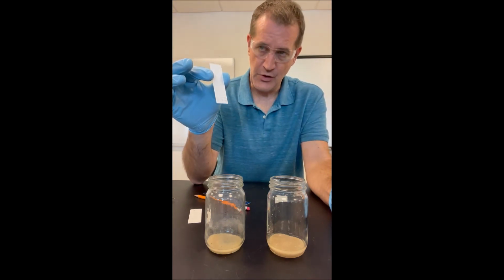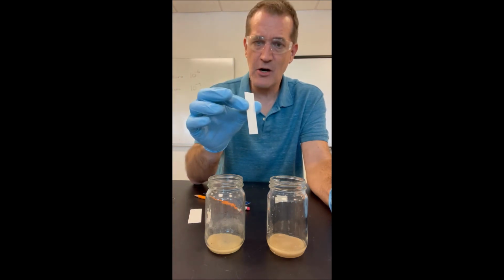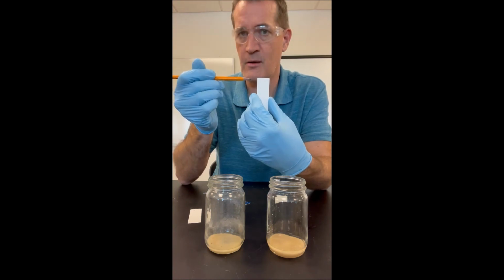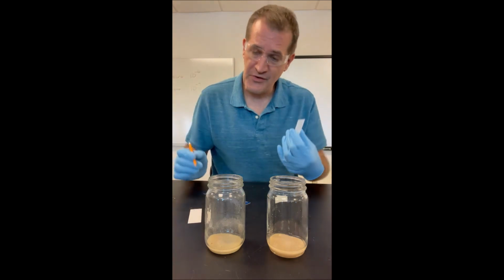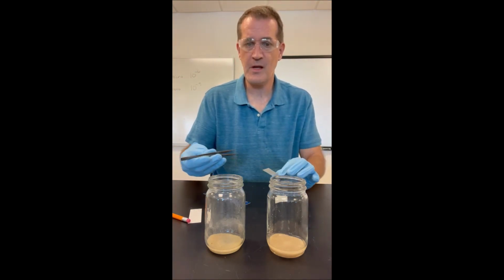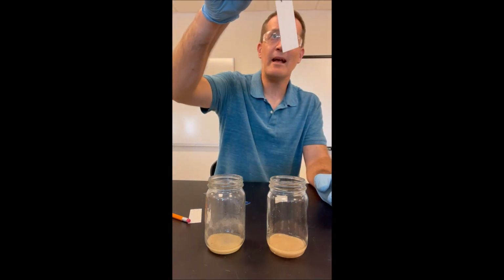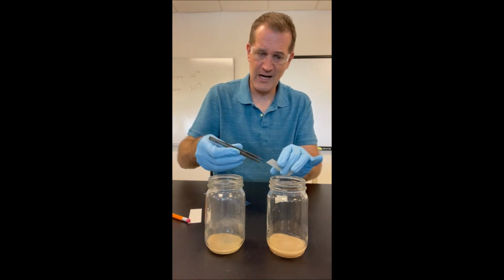And you want to make sure that you keep each of these TLC plates in the jars until the solvent rises to the top line that was marked in the first place. The only reason I'm doing that is so the solvent's rising up exactly the same distance in each of my 2 plates, all right? So I want to make sure that I'm careful about putting the plate in exactly flat relative to the level of the solvent, so I have to be careful here.